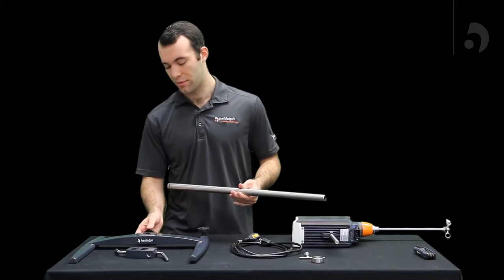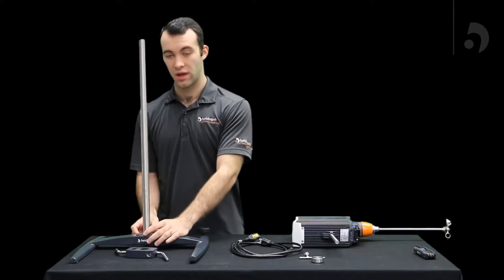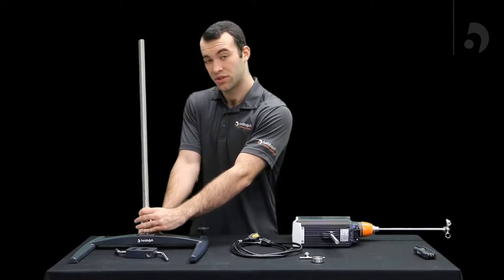Then once you've done that you're going to loosen the knob in the back and insert the rod into the hole. After that you're going to tighten the knob again until it is very tight.